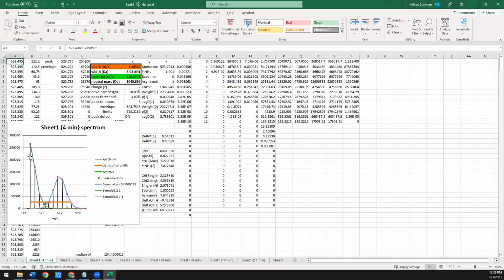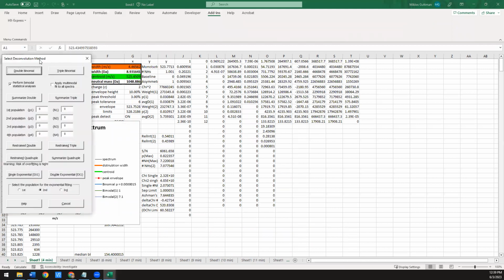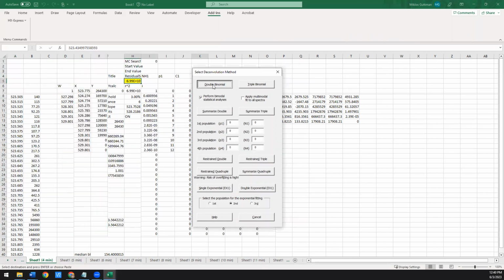So here's that first example. We're going to go back and we're going to repeat that double fit, having this perform bimodal statistic analysis on. Yeah, it takes a little extra time when you specify doing the statistical analyses, but again, this should be much faster on a high-powered desktop.